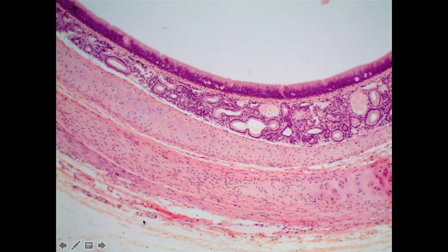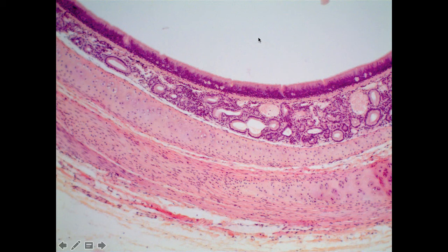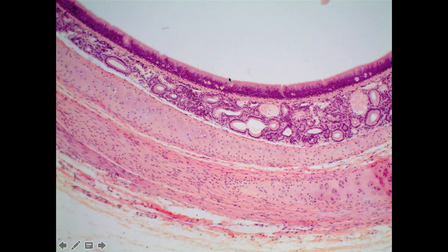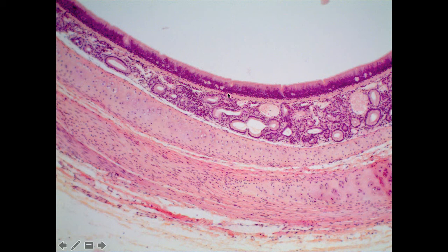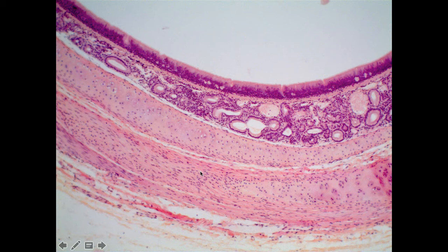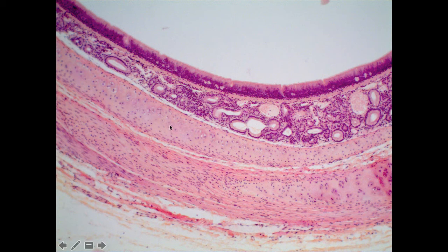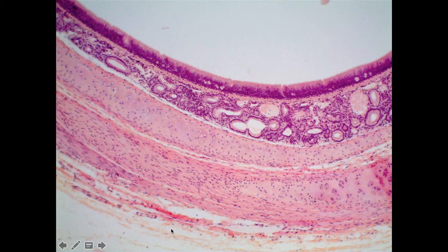The adventitia is the connective tissue that holds the trachea into the surrounding body tissue. Up here at the lumen, we have the mucosal layer, which has an epithelial layer as well as a small lamina propria. Below that is the submucosa, which in the case of the trachea has some glands — these tracheal glands are a mixture of both mucous and serous glands. The third region is the cartilage/muscle layer, where we can clearly see the cartilaginous rings — this is hyaline cartilage. And finally on the outside, we have the adventitia.